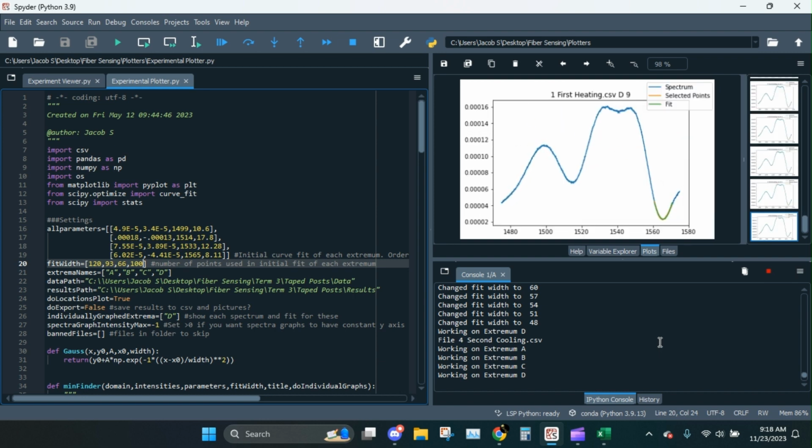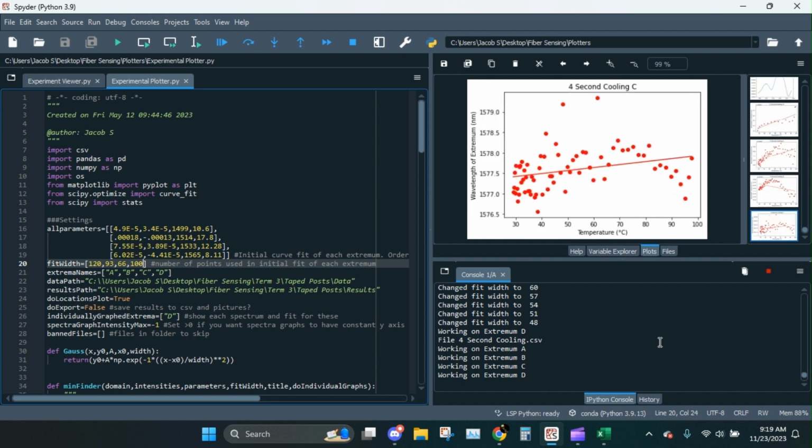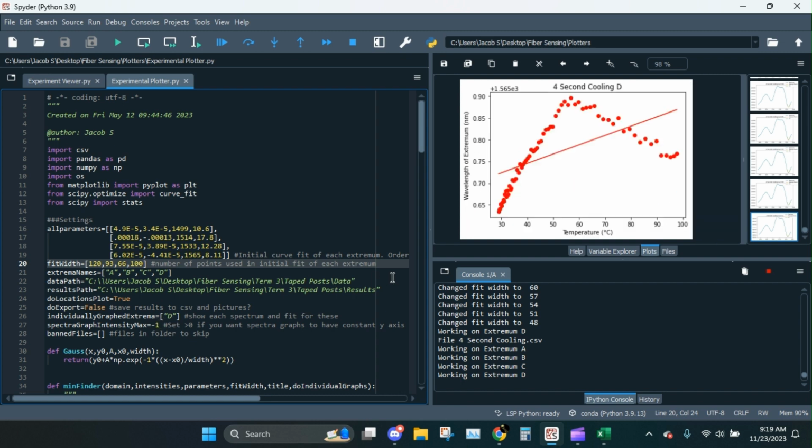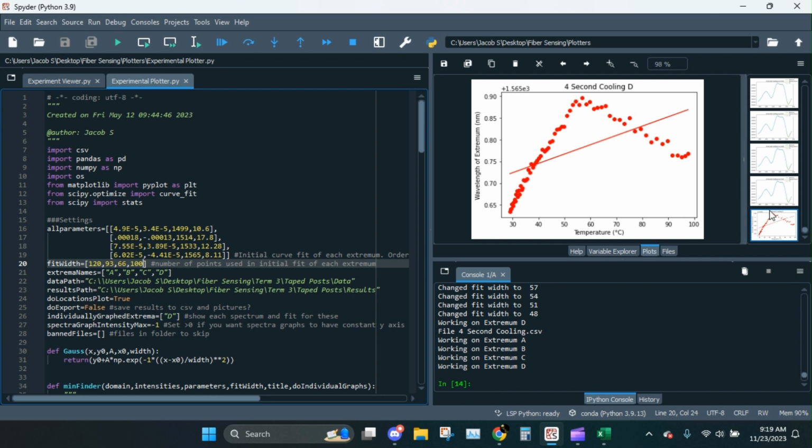I think we made it all the way through. Just watch this play out. And you can see how the y-axis is kind of going up and down a little bit. And again, that's because I set the max to a negative number, which says let it be whatever it needs to fit. Awesome. So I made it all the way through.